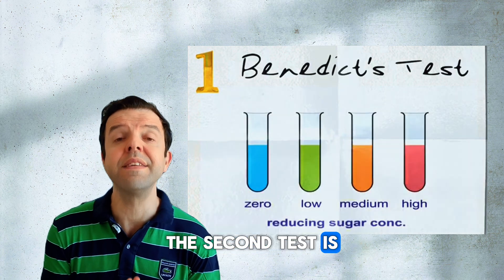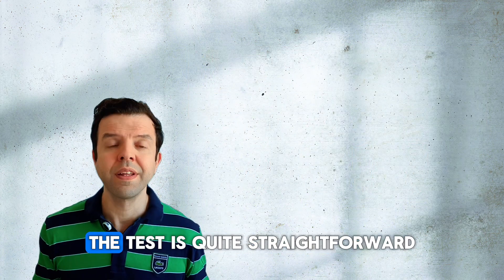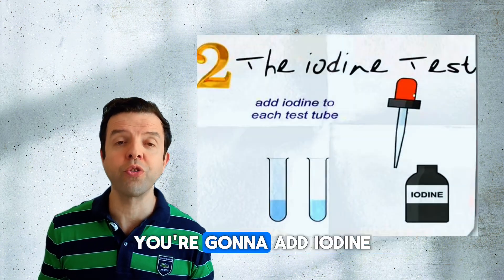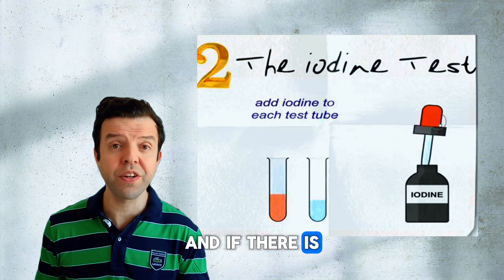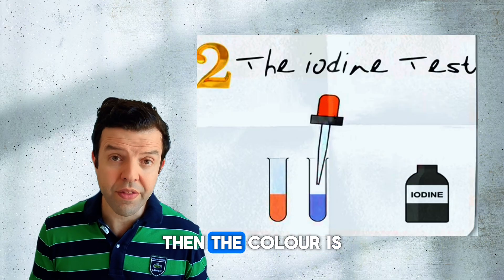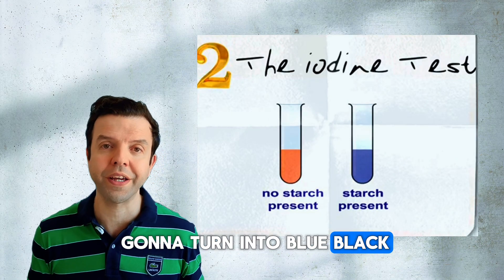The second test is the test of starch. The test is quite straightforward. You're going to add iodine solution, which has a brown color, and if there's any starch present, then the color is going to turn into blue-black.